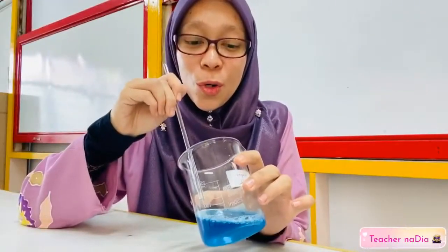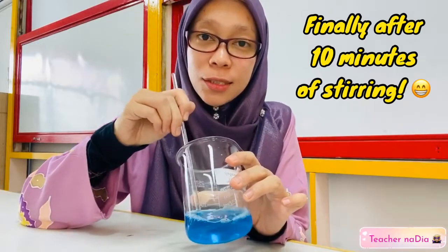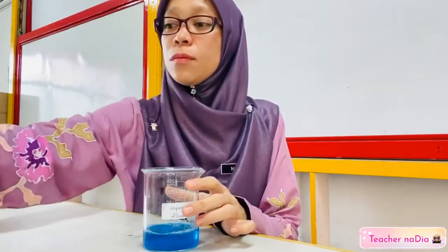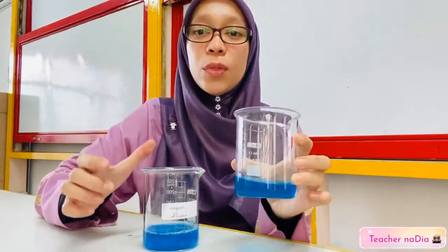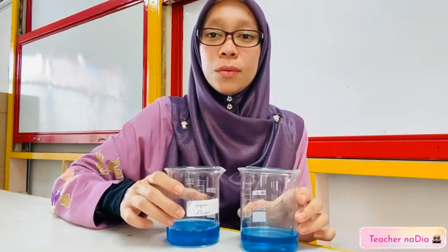Now all the copper sulfate has been dissolved in the distilled water. So we can see the difference. This one is P and this one is Q.